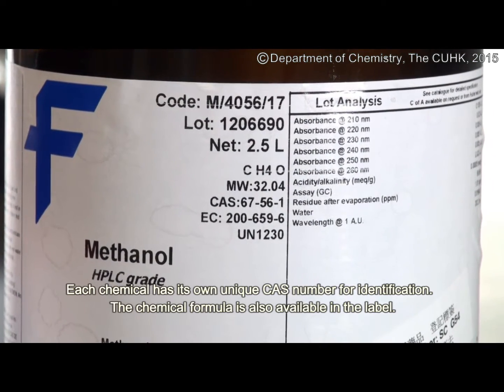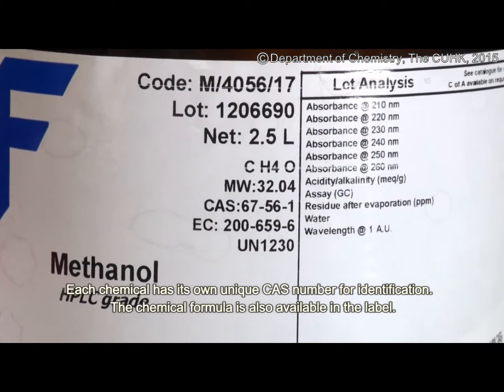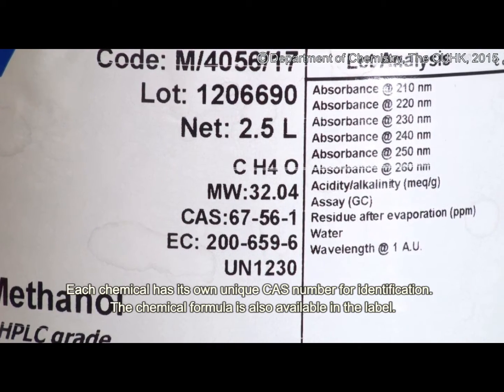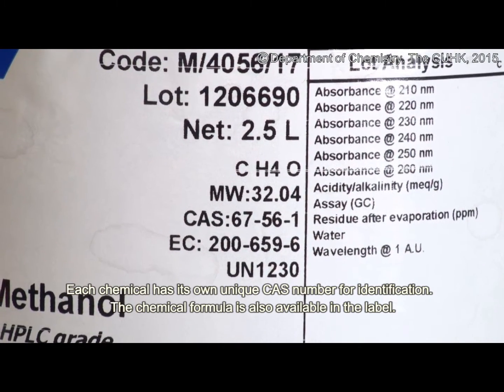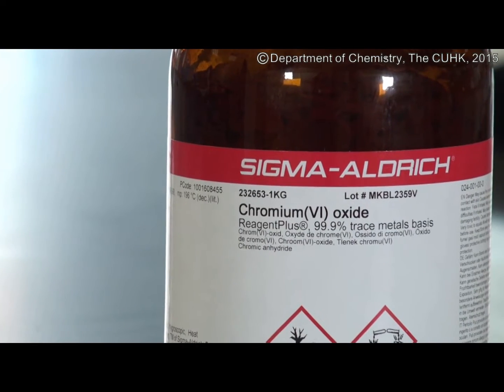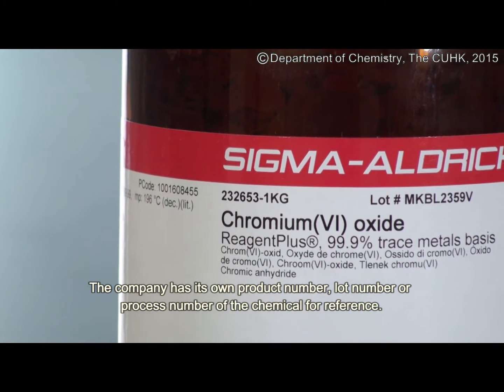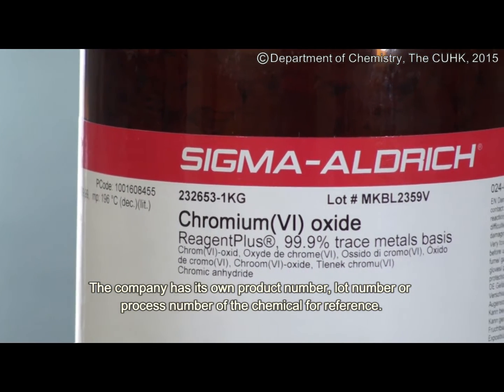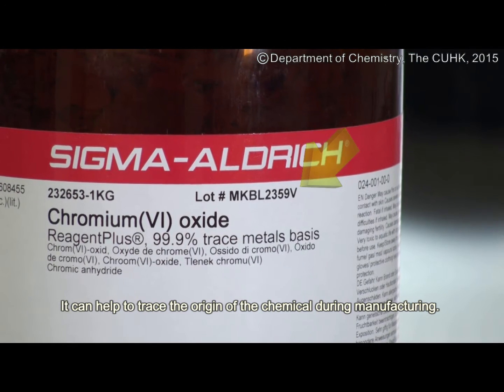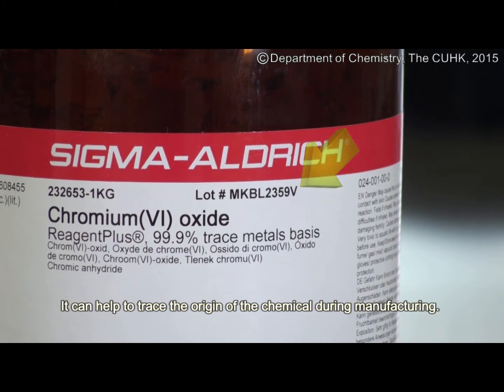Each chemical has its own unique CAS number for identification. The chemical formula is also available on the label. The company has its own product number, lot number, or process number of the chemical for reference. This can help to trace the origin of the chemical during manufacturing.